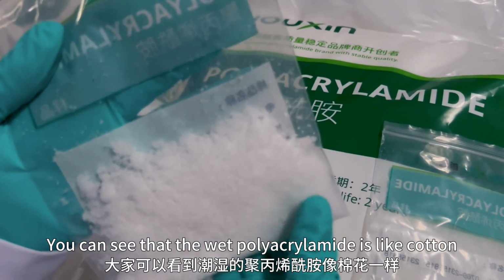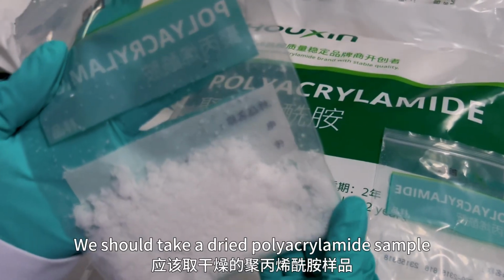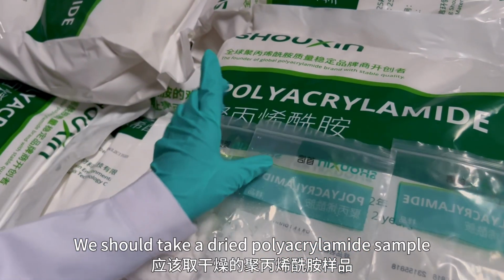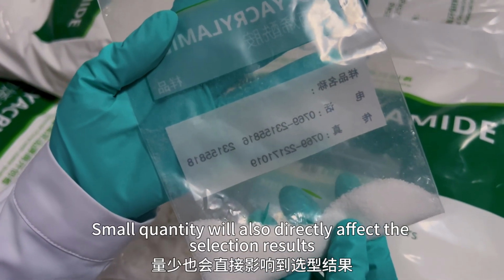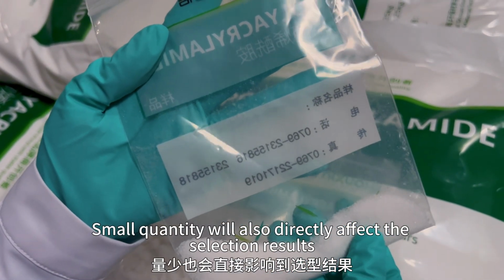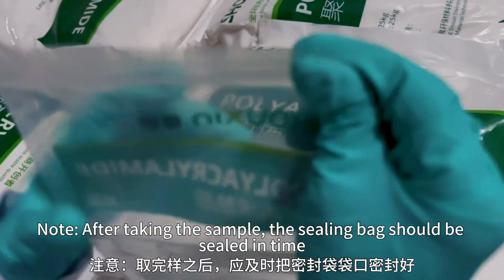You can see that the wet polyacrylamide is like cotton, which is unusable. We should take a dried polyacrylamide sample. Third, the sampling volume cannot be too small. A small quantity will also directly affect the selection results. Note: after taking the sample, the sealing bag should be sealed in time.